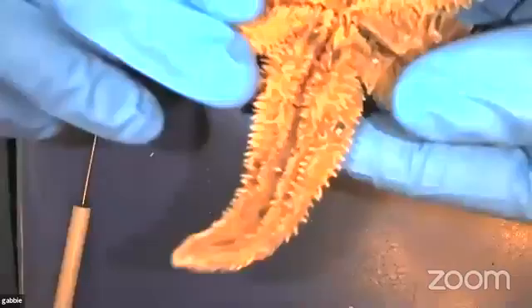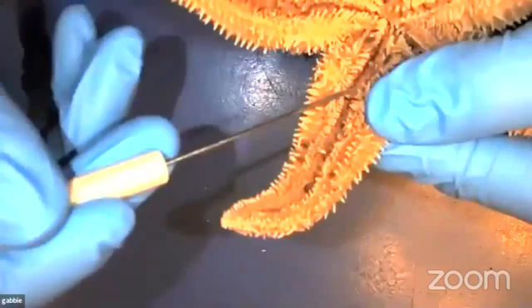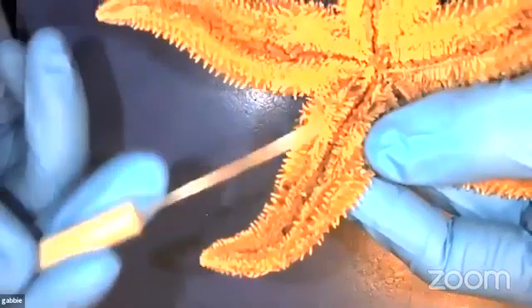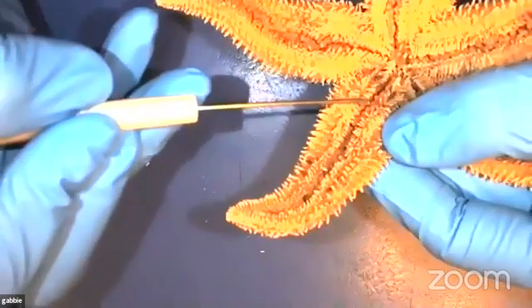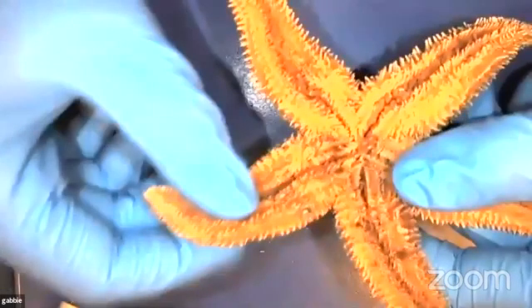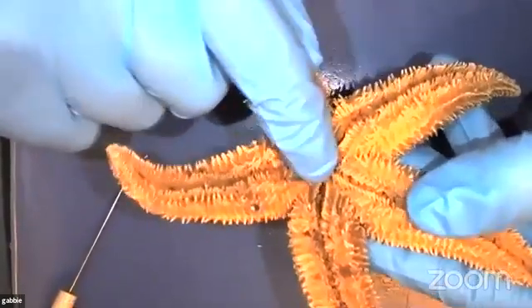around. So right underneath the sea star, in these columns that you can see here, they have something called tube feet. Now they're very tiny little finger-like appendages that they can pump with water, and then they move with muscles, and that moves those little tiny feet. So imagine a big boat of a bunch of people rowing together. That helps move the sea star along, so they can swim with these tube feet. They also use their arms to help catch prey. So they grab onto things like clams and mollusks, and they bring it into their mouth, which is right in the center on the bottom of the sea star here.